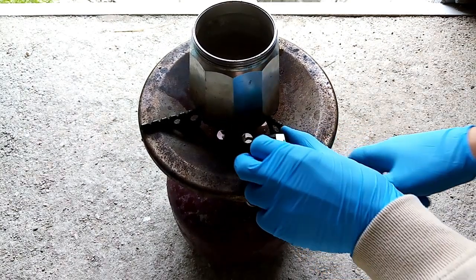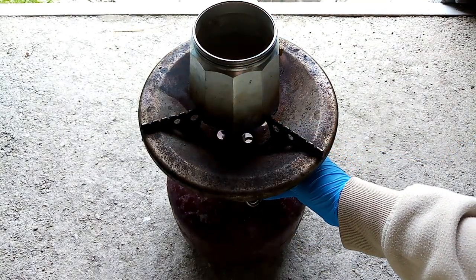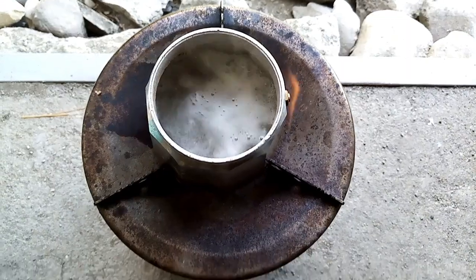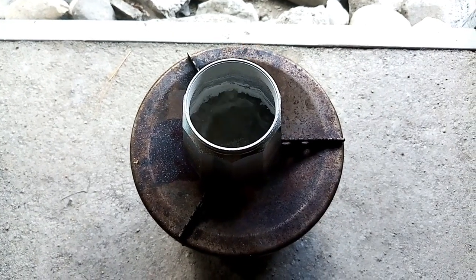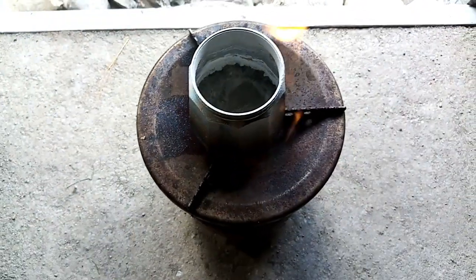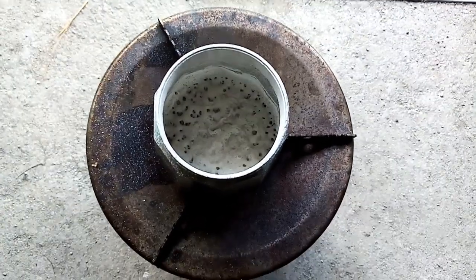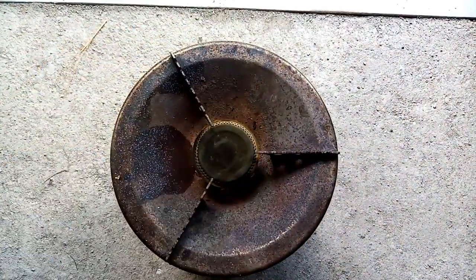After that, I crank up the heating and let the mixture boil off. After a while, the mixture starts boiling. After the volume of water decreased, a white crust was forming on top of the solution. At this point, we're not gonna let it boil so much. When it looks like that, you can take it off the heat.